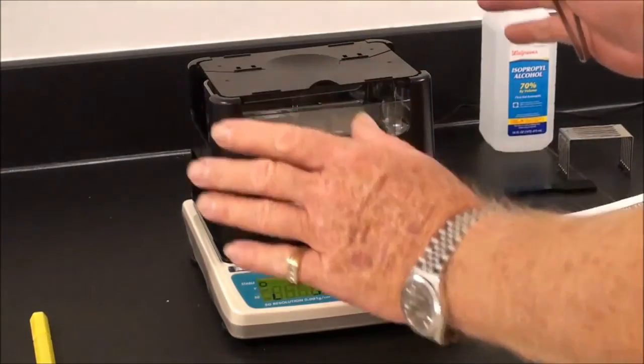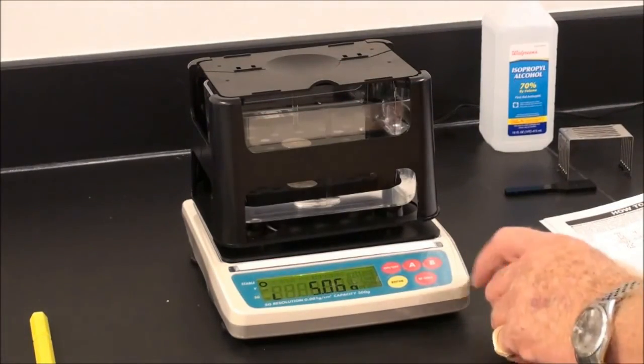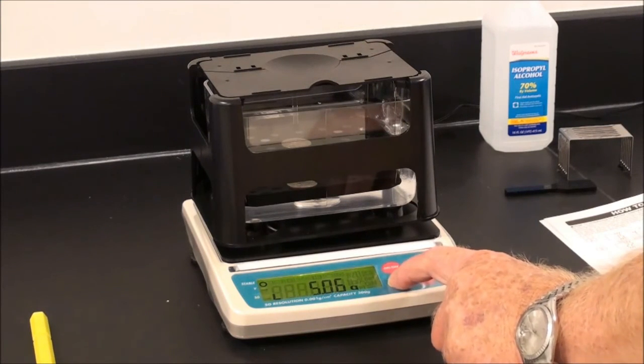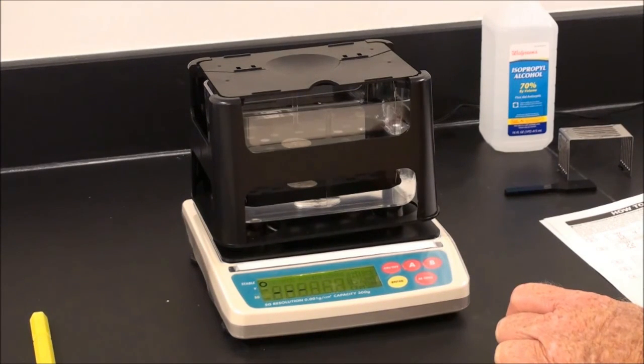Always use gentle motion. Press B, then enter. There's our specific gravity.